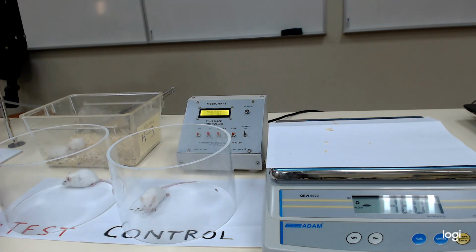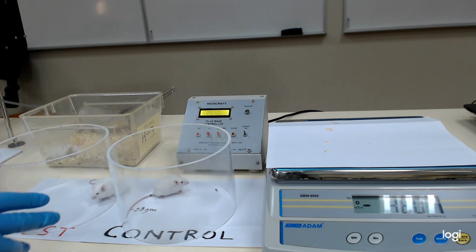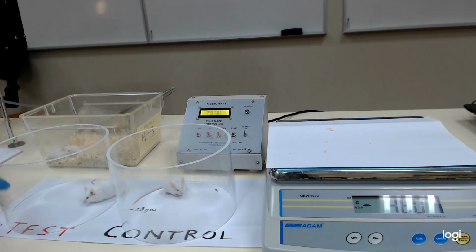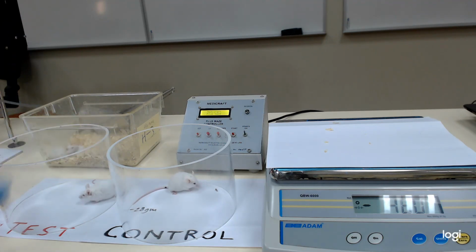As far as the control animal is concerned, we give it normal saline. Though we know it has no therapeutic value or effect, we want to have similar conditions for both the groups. Whatever intervention or procedure you follow for test, you have to follow for the control. So we will also wait for 1 hour after injecting. You have to note down the time of injection for each animal, and after administering the drug, you have to wait for 1 hour.